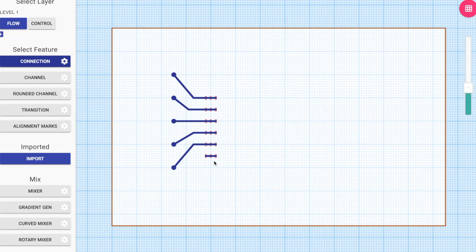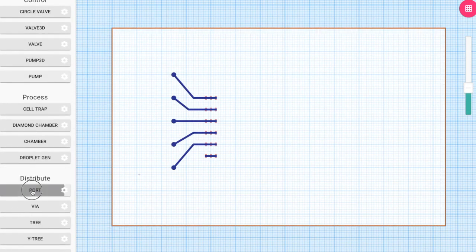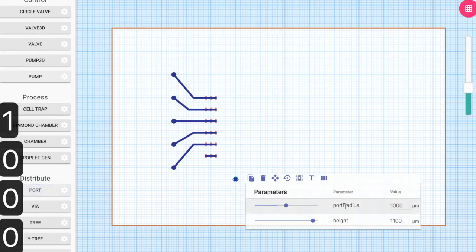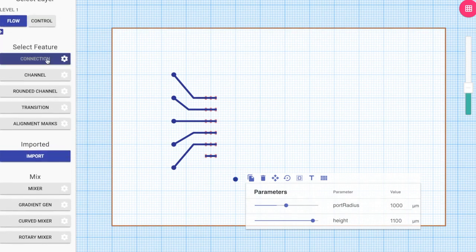Now that the ports have been completed, I reset the view by pressing the F key, and I'm going to create one more port which is required for this final pump, and set the radius, and then create the connection between the pump and the port. As you can see, I created multiple waypoints by left clicking as I went along.